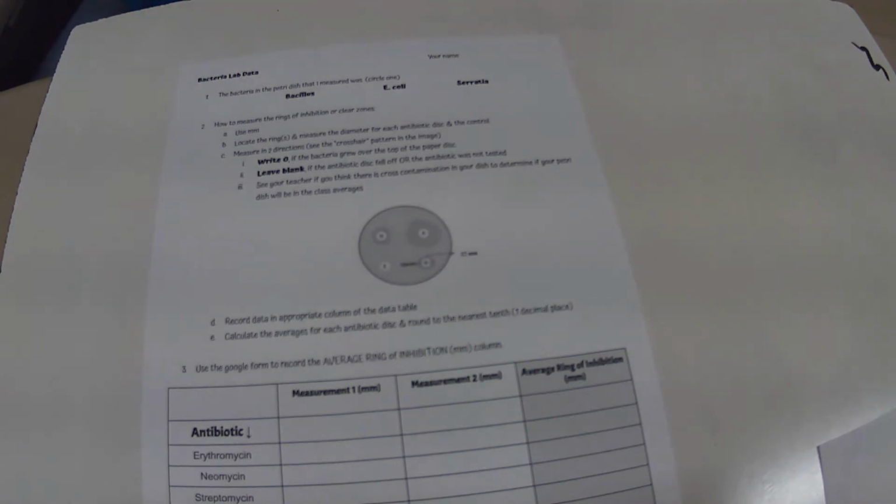So today in class, we actually gathered data from the bacteria lab that we've done yesterday and last week. So we plated the different bacteria, we tested them against antibiotics, and now you guys have a little bit of background about what an antibiotic does, how it kills bacteria, and you actually might have a little bit of knowledge about the bacteria that we plated. So today we're going to actually look at what the data looks like, how our students collected data, and this will lead us into our project that'll be assigned on Friday. So let's get going with it.